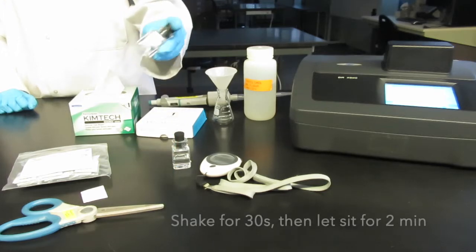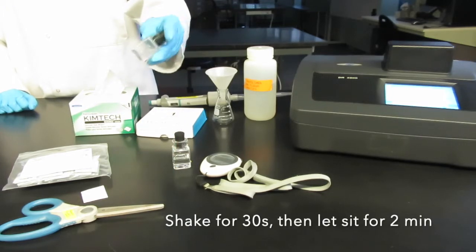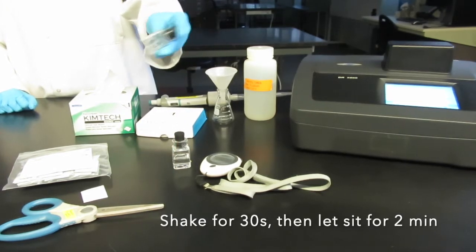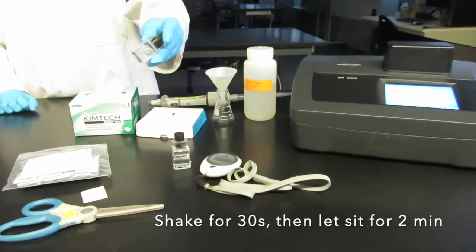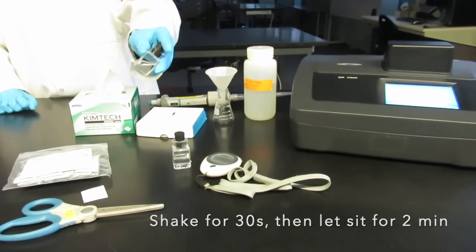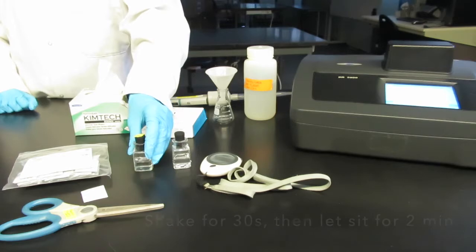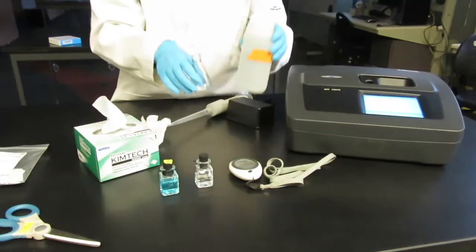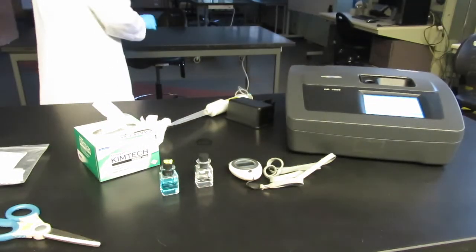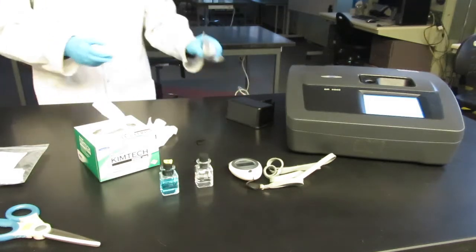Put the stopper on your sample cuvette and shake vigorously for 30 seconds. Let your sample sit for two minutes. In the meantime declutter your work area in order to operate safely and avoid spills.